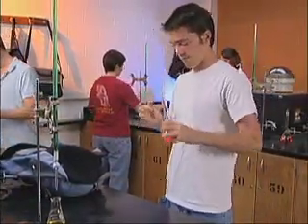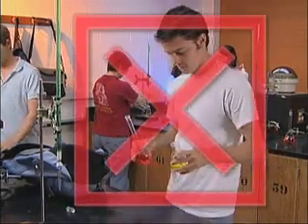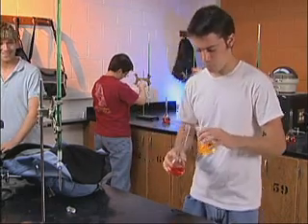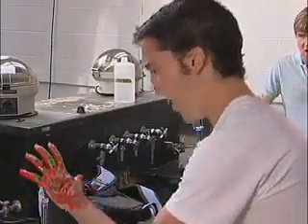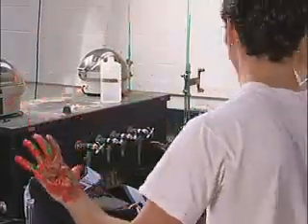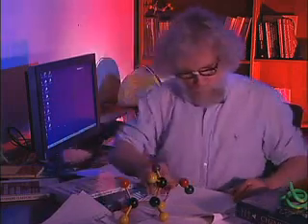Rule number 1, working without a supervisor is forbidden. Rule number 9, to prevent harmful effects, gloves must be worn when needed. Well, if you think that's bad, just wait till you see what he did next.